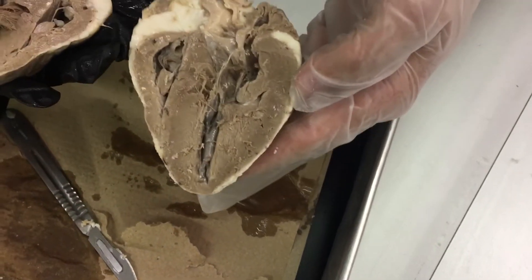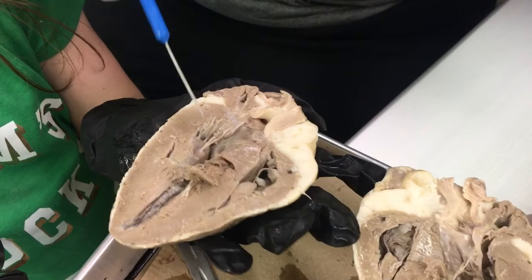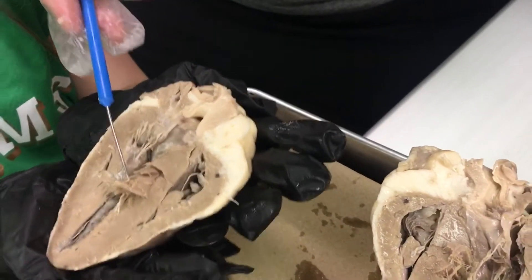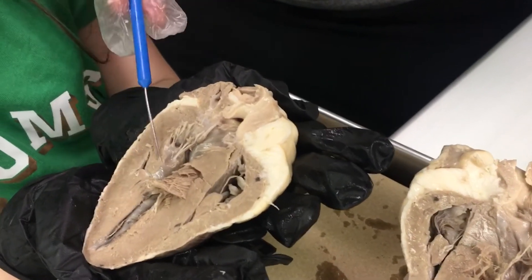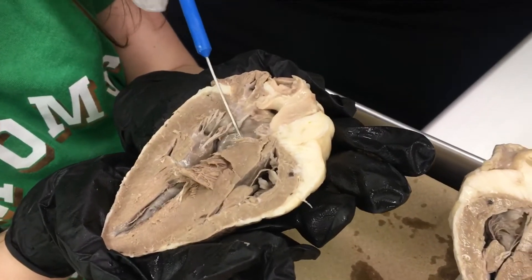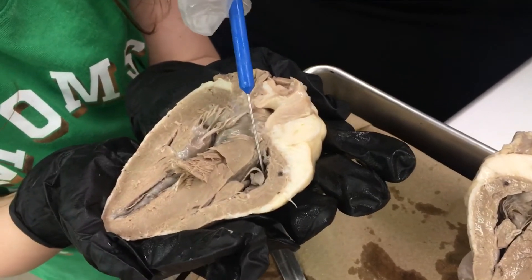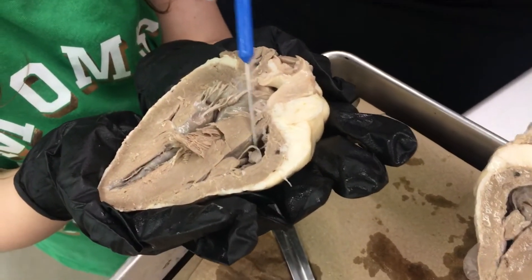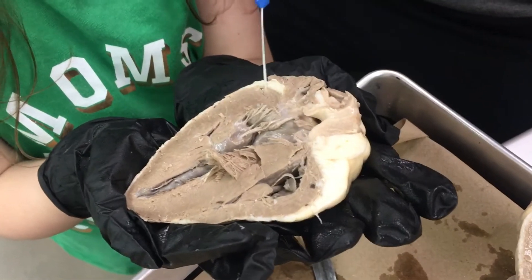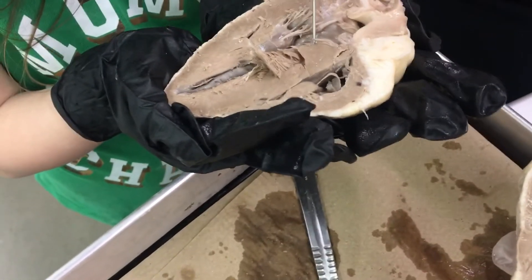Another thing you can see is the chordae tendineae — the little cords that attach to the valves. This is the left ventricle here, so that's going to be the mitral valve that they're attached to. There's the valve right there. The tricuspid valve is over on the right side of the heart. Sometimes they also call the mitral valve the bicuspid valve.